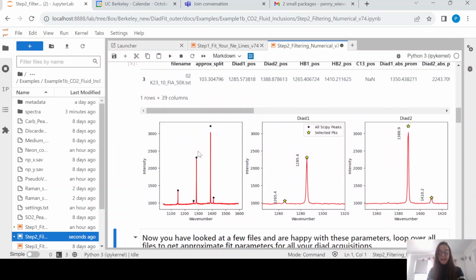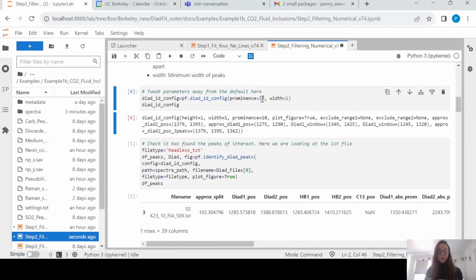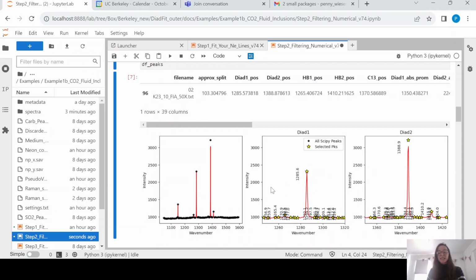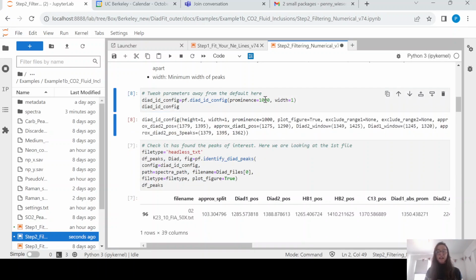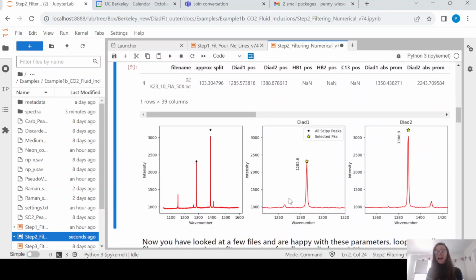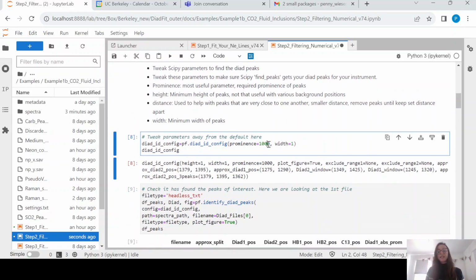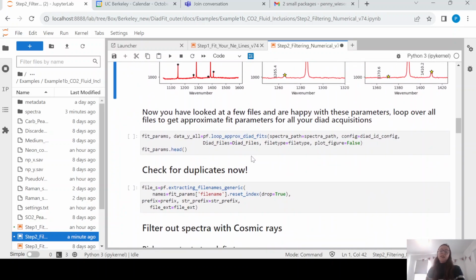So you can see the algorithm has certainly found my peaks. It's found diad 1, it's found diad 2, and it's found the hot bands. It has also found an SO2 peak, you can see here. So if you were to adjust that prominence, you suddenly find a lot more peaks. That's not really ideal, you don't want to be finding this many peaks, but the algorithm can actually deal with it. The biggest problem is if you set this value too high. If you set this too high, it hasn't found your hot bands. So if you wanted to fit your hot bands or your SO2, that would be less than ideal. So let's just put it back to 30 as a reasonable approximation. It doesn't matter too much, you just want to make sure it's finding the diads and the hot bands. Okay, so that's for one file.